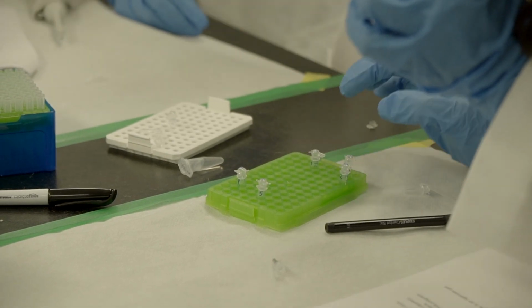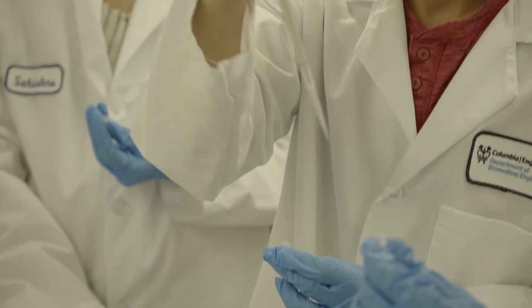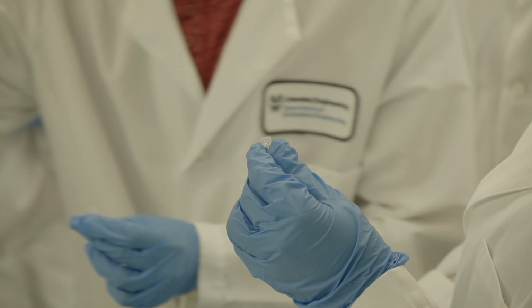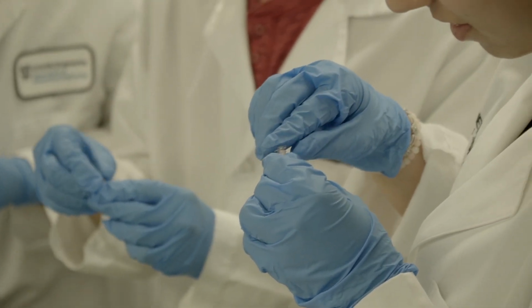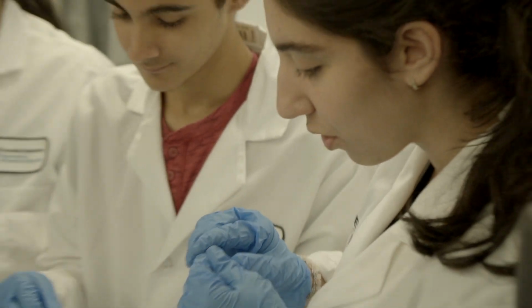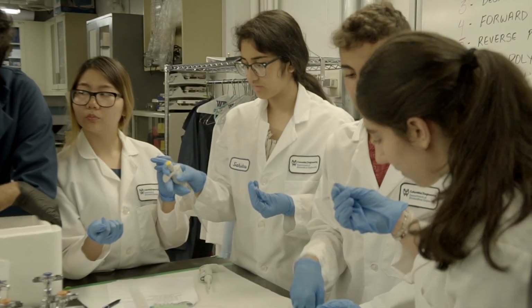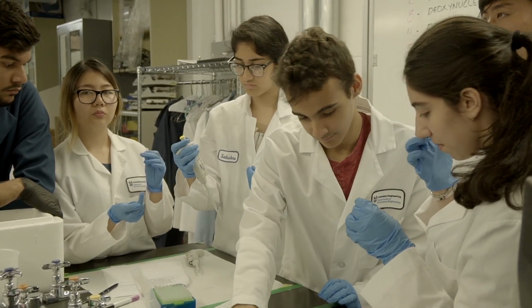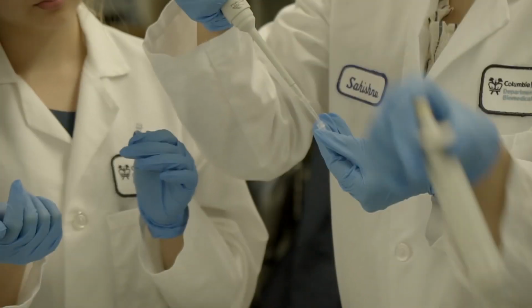Everybody still good? Okay, YA1. Oh, they only have a bigger one. Let me see which one you guys are on. We're on... So you need 5 microliters. They don't have one that can do 5, so they could just do 2, 2, and 1 out of it. They don't have a P20 here? There's a P20 right here. Oh, you guys have one? Yeah, you just have to share your pipettes.